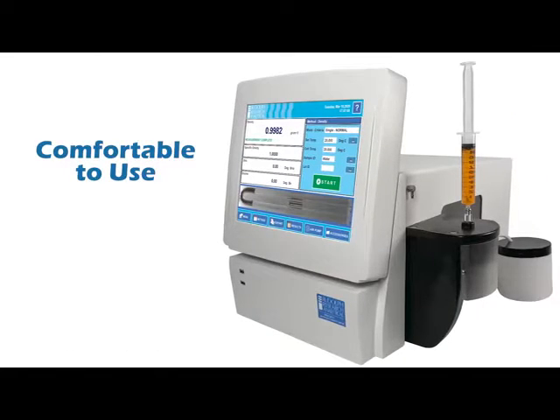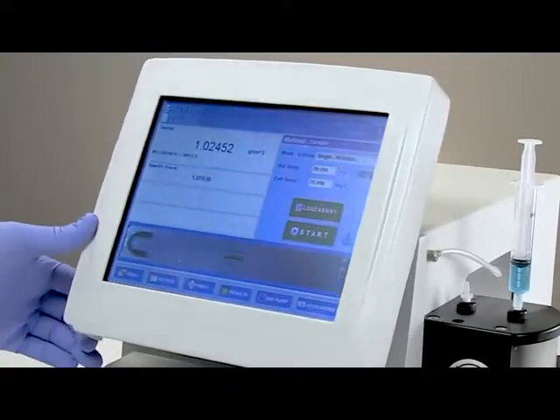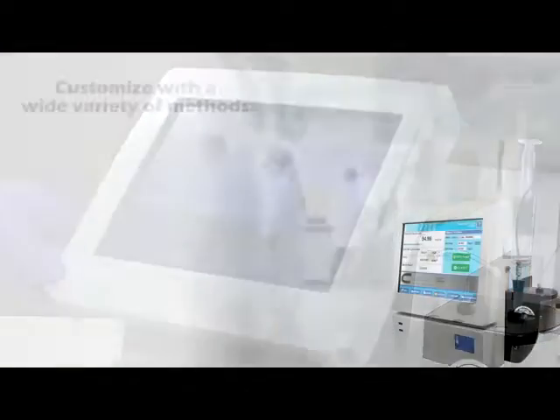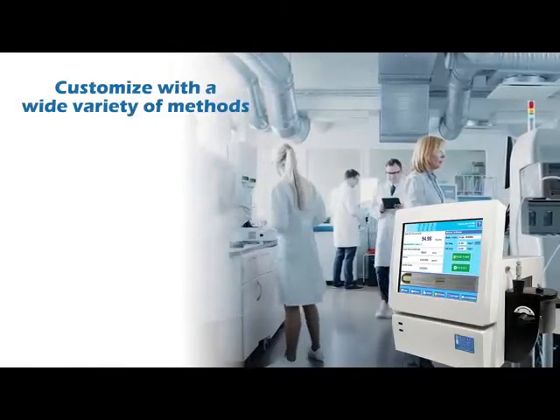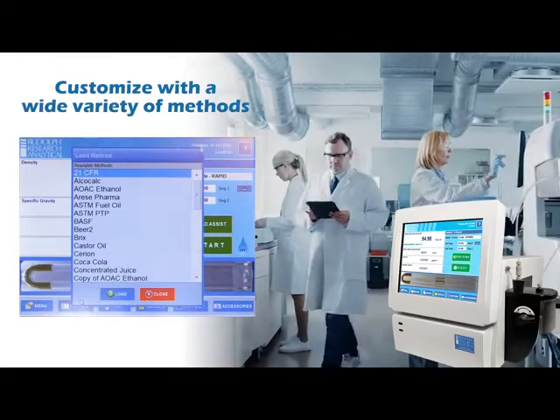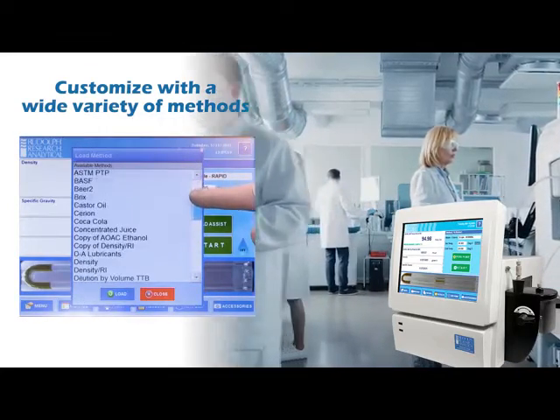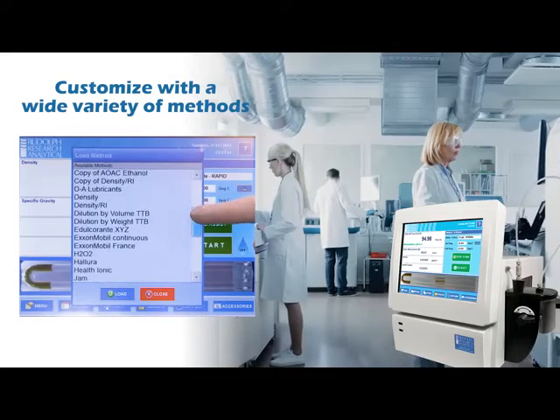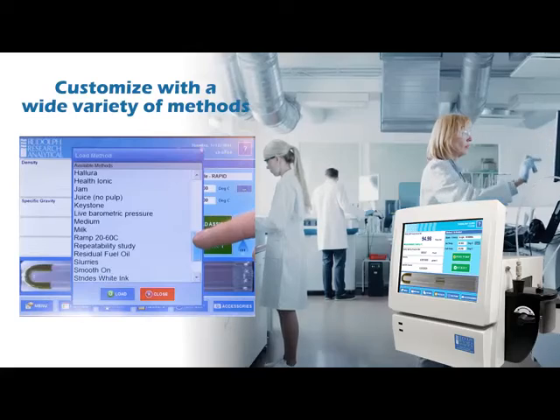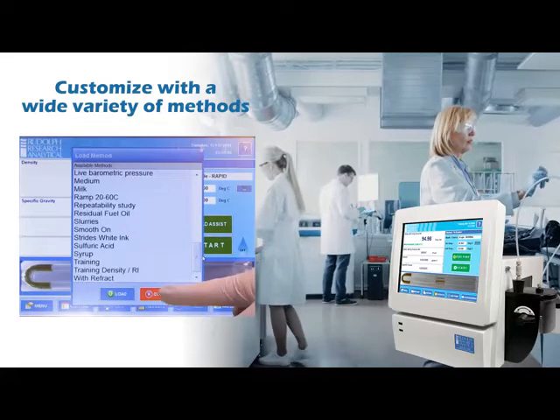A laboratory instrument should be comfortable to use. Ergonomic screen design makes it comfortable for taller or shorter operators with an easy-to-operate touch screen. The Rudolph density meter can be customized with a wide variety of methods, and new customized methods are easily added by the user. For unique measurement applications, easily create a sample method using an unlimited number of concentration tables, formulas, and polynomials to match the measurement methods used in your laboratory.